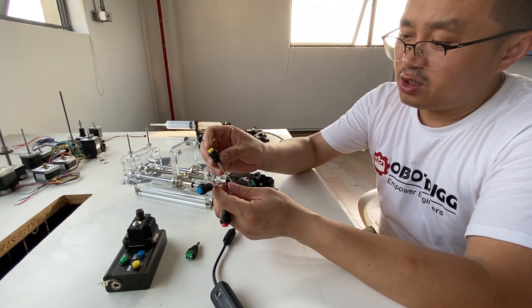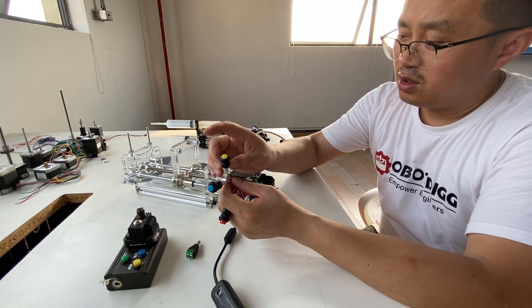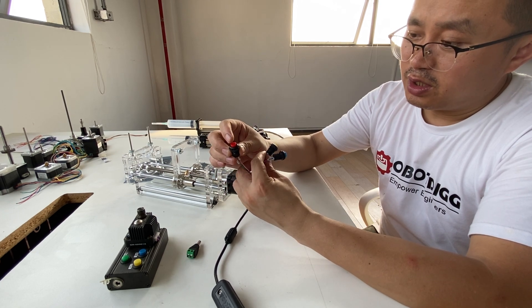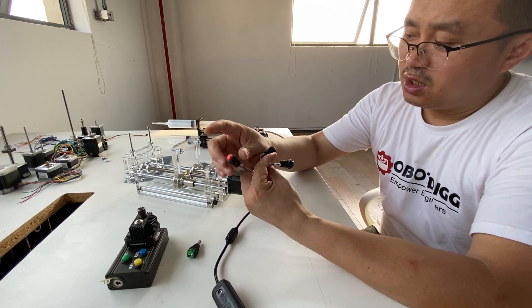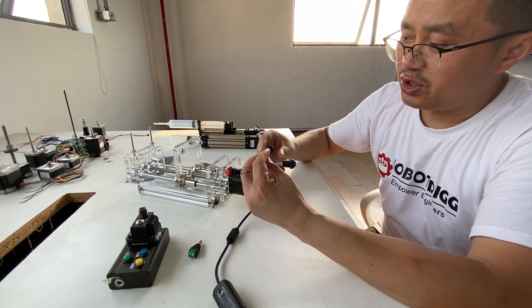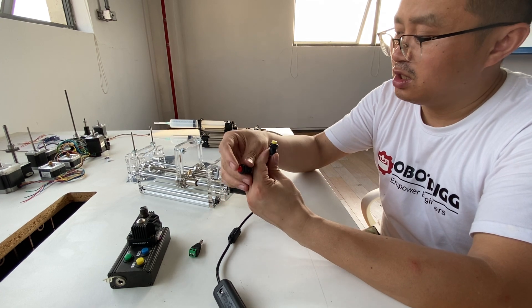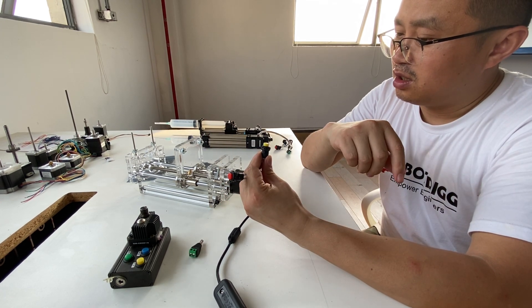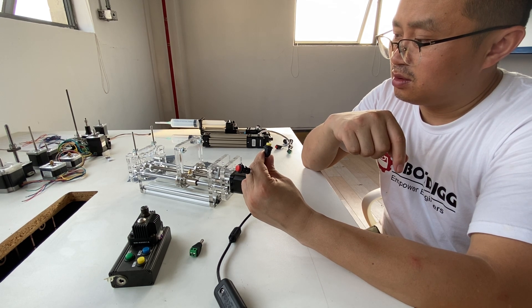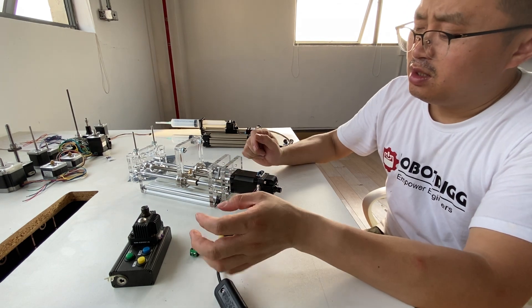So what is the function of this one — the yellow button? When we click the yellow button and then press the red button, the direction is changed. We click the yellow button and then press the red button.